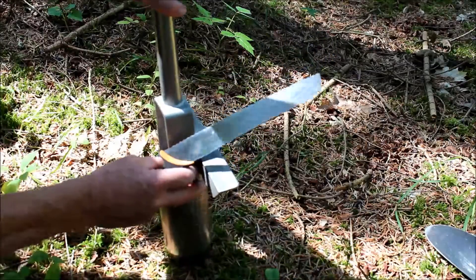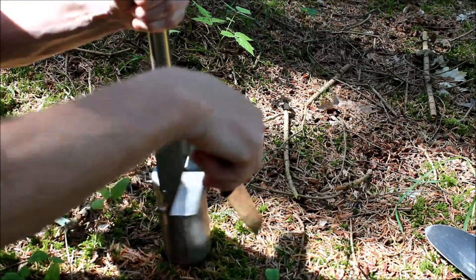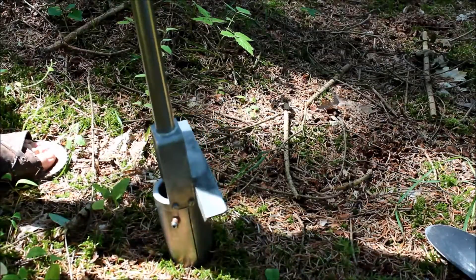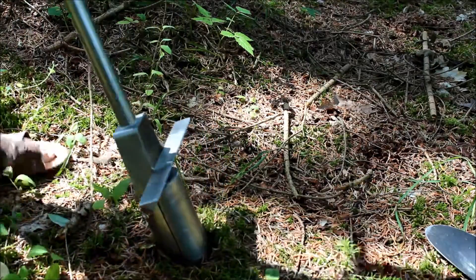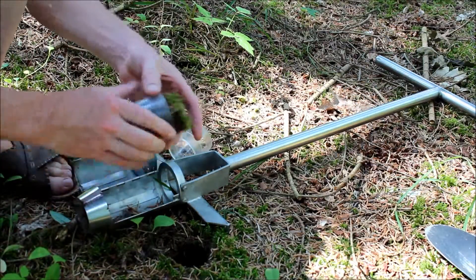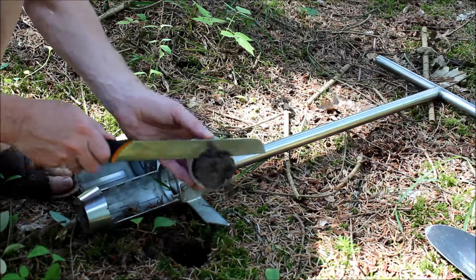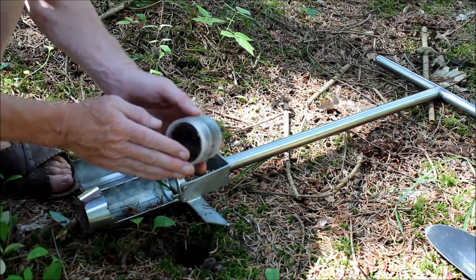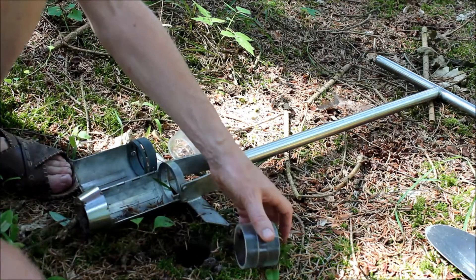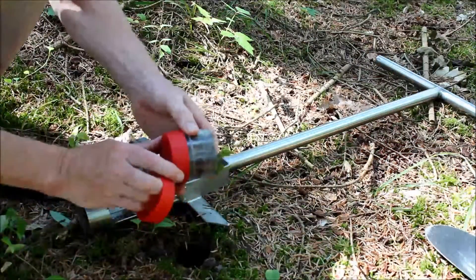You do the same as when you have true mineral soil — cut along the rim and press it down, then pick it up and take a look at how it looks. In this case you can see that we have actually some mineral soil in the bottom. It's very sandy, which often happens. The sand might drop out of the cylinder, but it doesn't matter — it's not so important. In this case it's because it's very dry, and there won't be a lot of animals anymore.